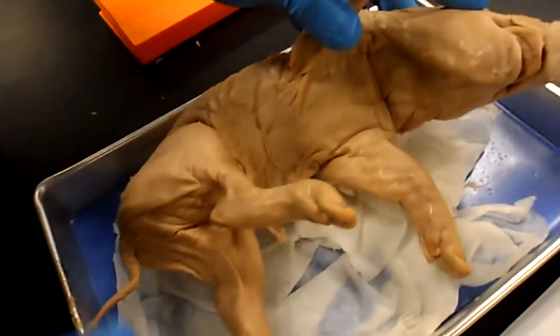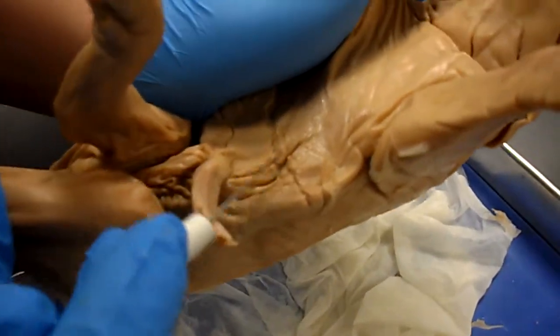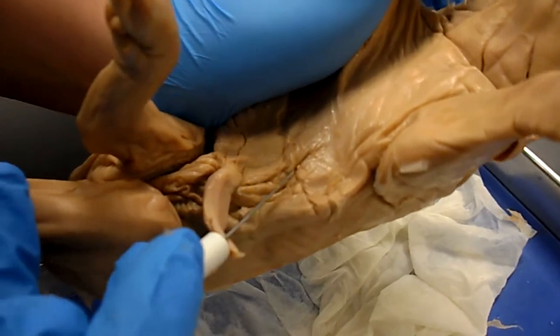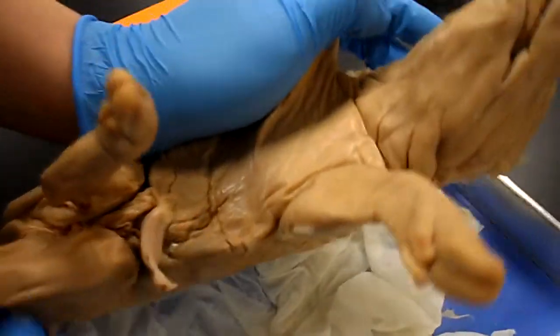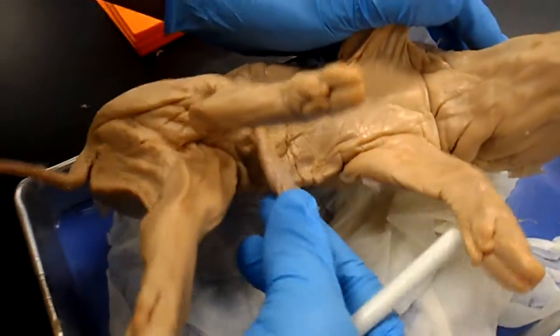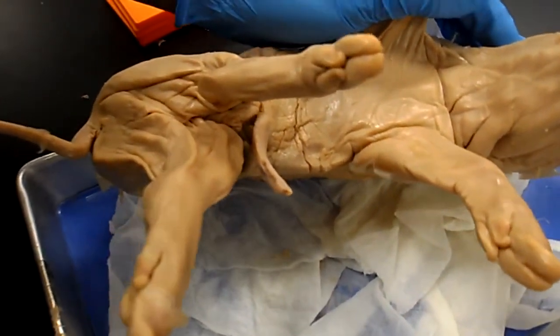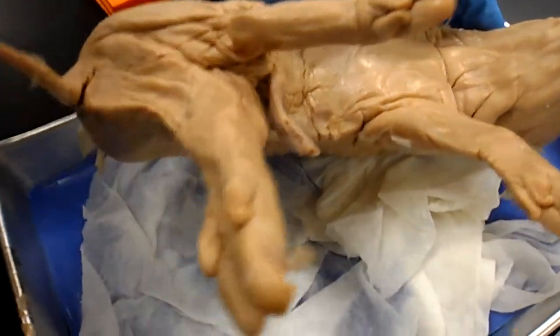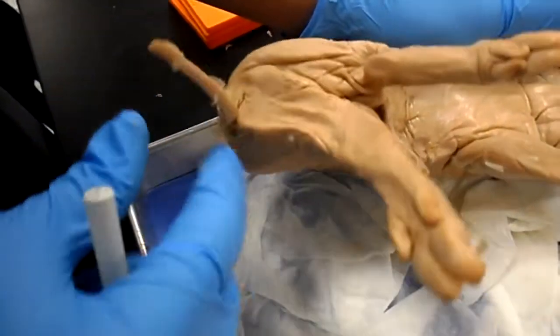The mammary papillae are those nipples — there's like one there and two. And the umbilical cord is where the nutrients are for the pig. The gluteal region is towards the back of the pig.